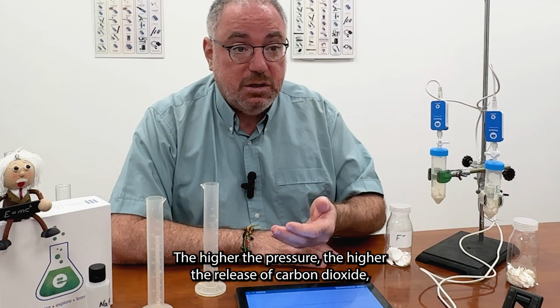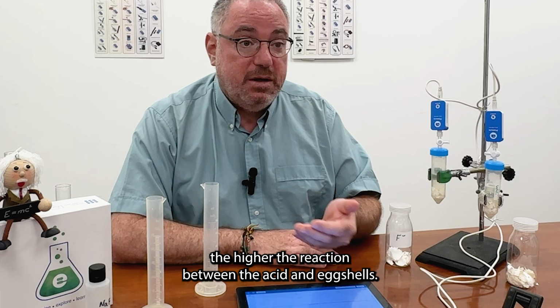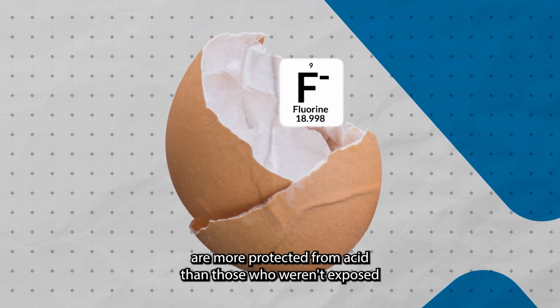The higher the pressure, the higher the release of carbon dioxide, the higher the reaction between the acid and the eggshells. We can conclude here that eggshells that were exposed to fluoride are more protected from acid than those who weren't exposed.